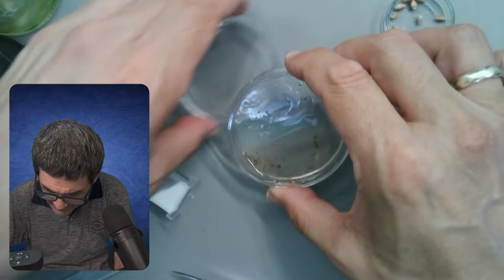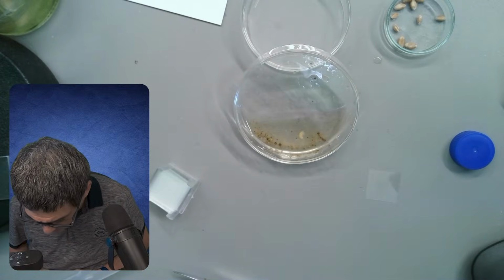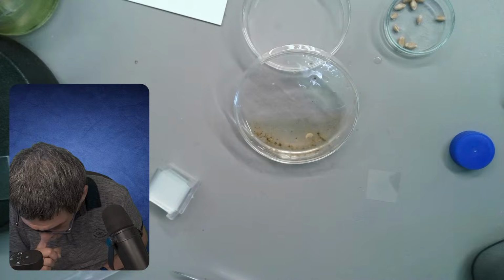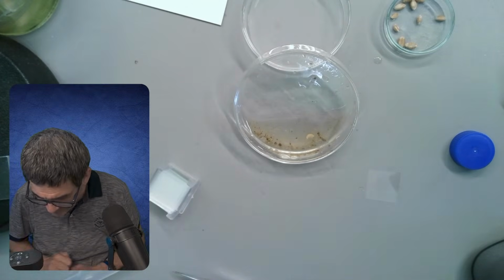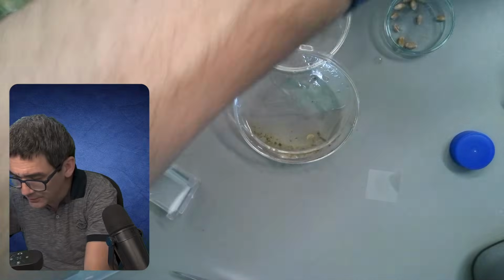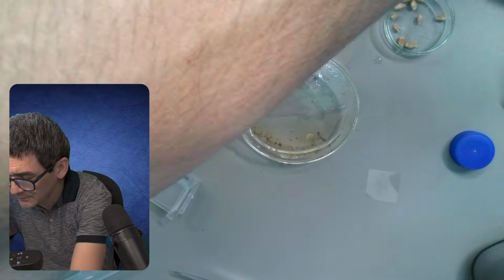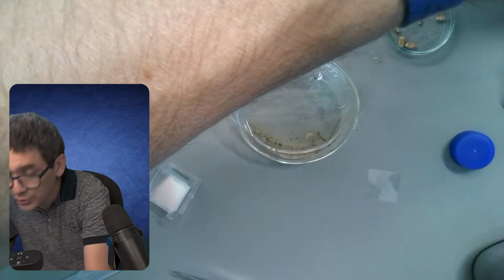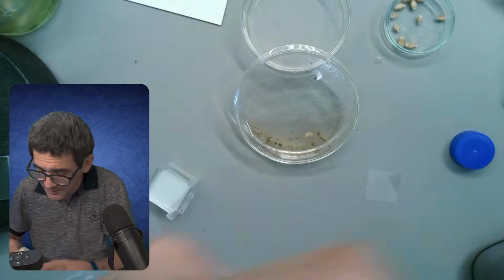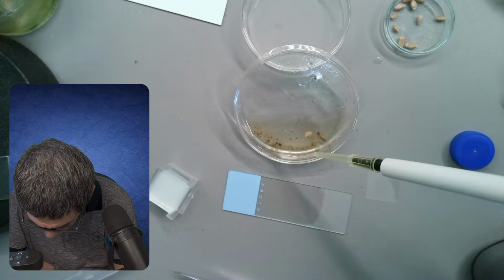And something like this. So, and then usually wait a little bit. I mean, there is movement going on in here. I can see that. Let everything settle down for a minute or so. And then we're going to give it another try. And then I'm going to show you, also checking the time a little bit, one of my failed experiments that I've tried yesterday. But there is movement going on. I wonder what that is.